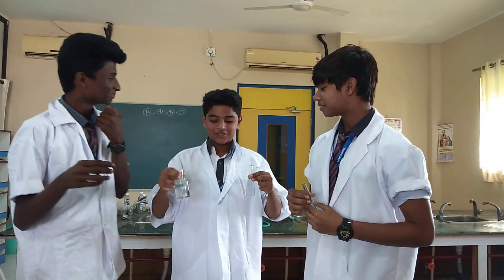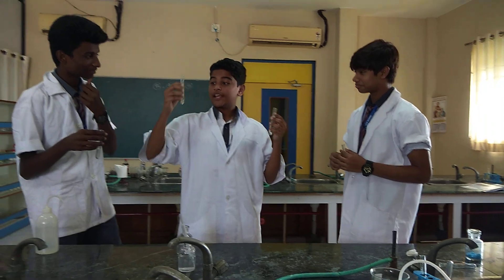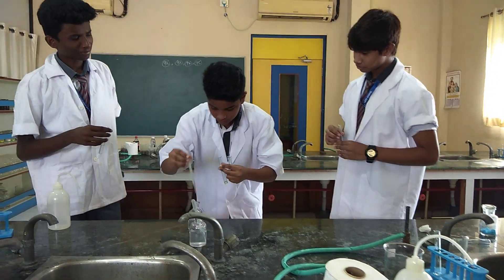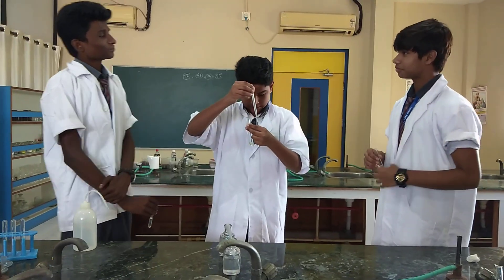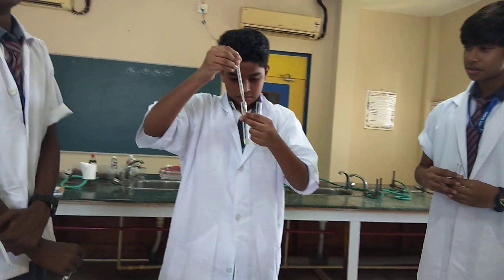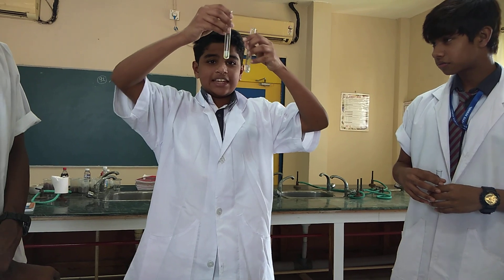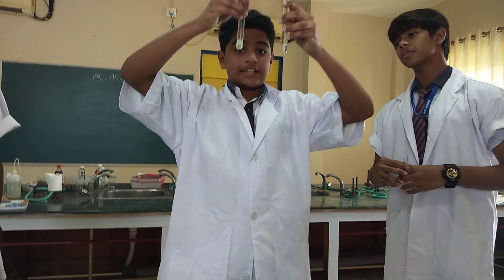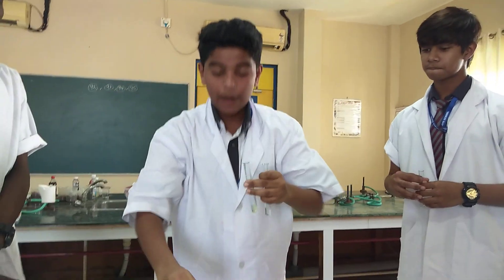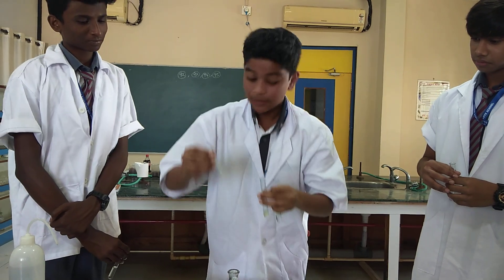I have the solution. I have aluminium sulphate solution and zinc sulphate solution. I'm going to add ammonia to both of these. As you can see, in both sulphate solutions there is some precipitate forming. Now I'm going to add excess ammonia to these solutions and see what happens.